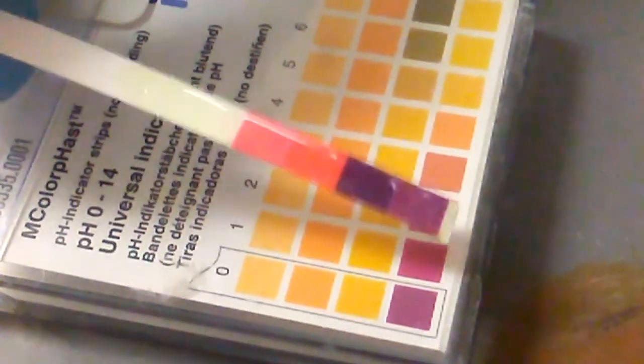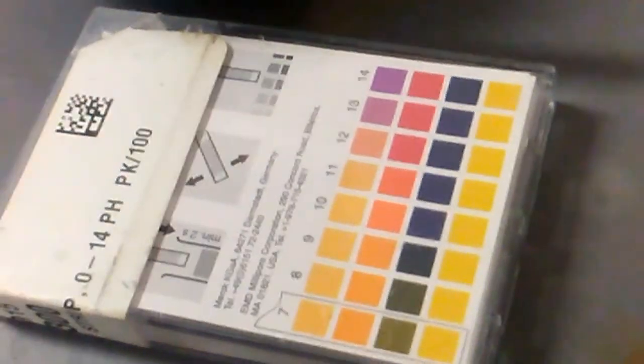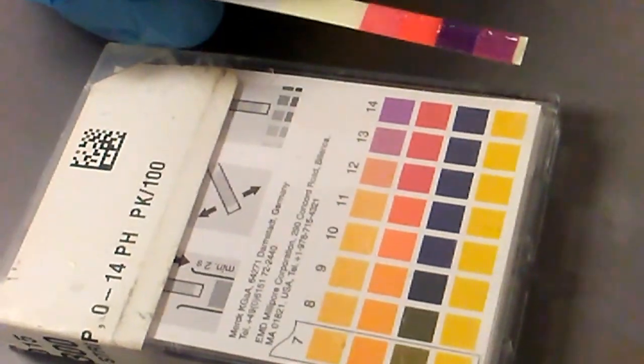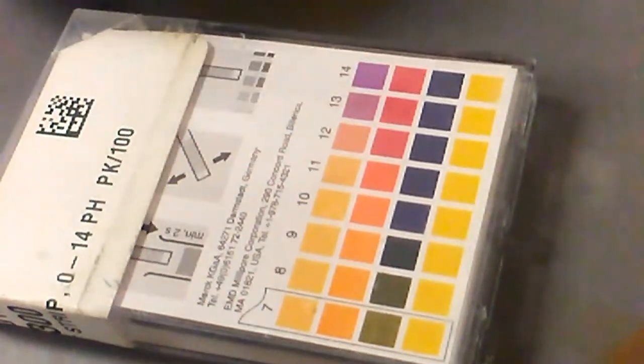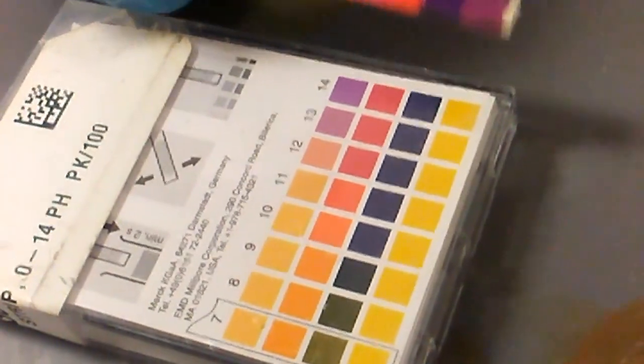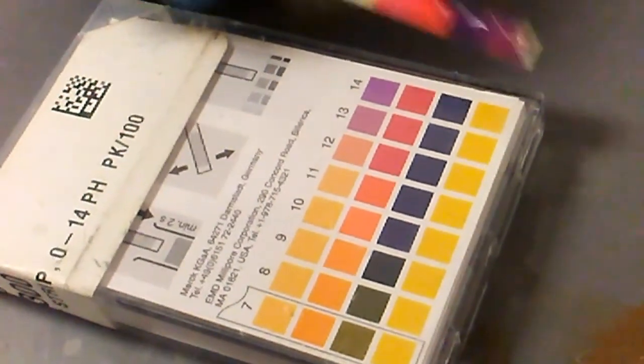Should be the other side, I think. Yeah. Huh. It's not exactly telling me what it is. Do you see anything? Like, do you see what pH? I think it's 14. Yeah, that doesn't make sense though. This is sulfuric acid. Nope. Should be on the other side. Yeah, I checked the other side. It's a 1. Maybe, I think it's less than 1.